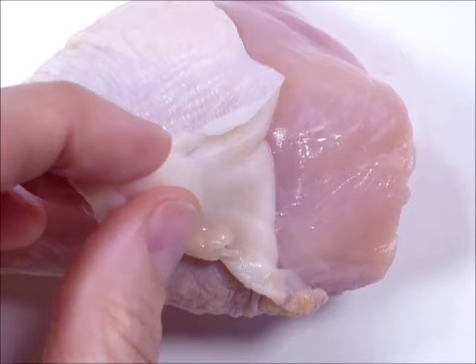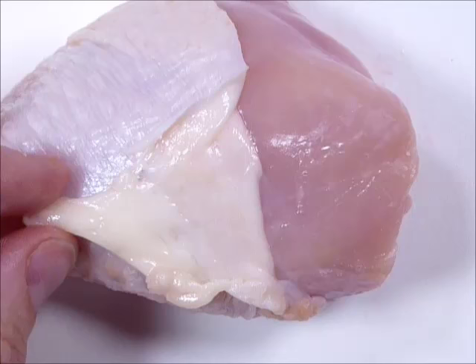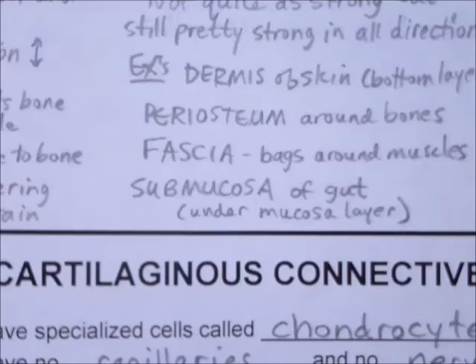We know that skin has an epidermis on top and the dermis underneath. I'm looking at the bottom of the skin, so I know I'm looking at the dermis. That will be classified as irregular dense. We're going to see several areas of irregular dense — on our sheet it lists dermis, periosteum, and fascia, which we'll talk about in just a minute. We won't see submucosa, but we're going to see a lot of fascia.